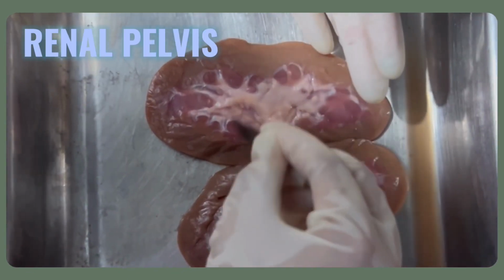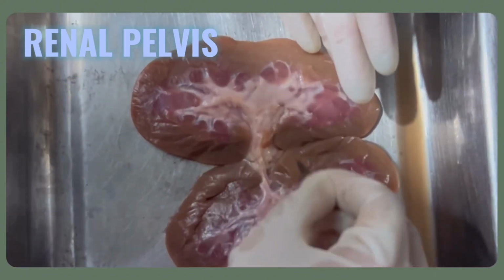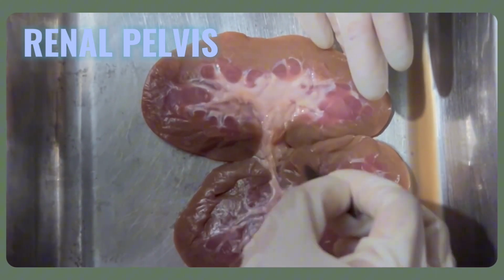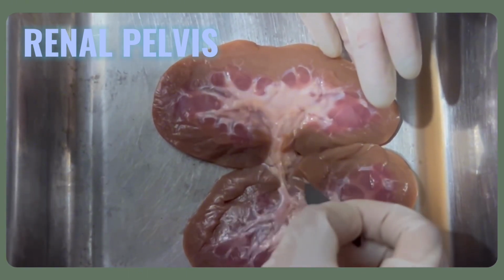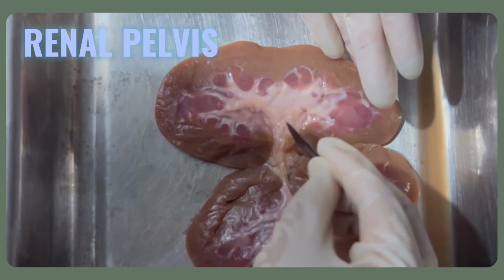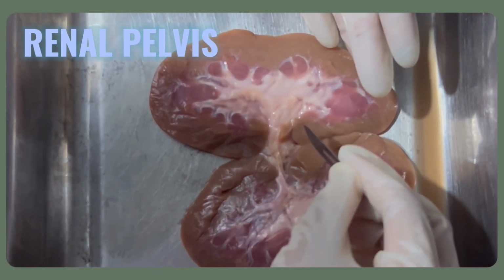Lastly is the renal pelvis. This is the renal pelvis. The renal pelvis is a funnel-shaped structure located in the center of each kidney. It is responsible for collecting urine from the nephrons and then transporting it to the ureters.